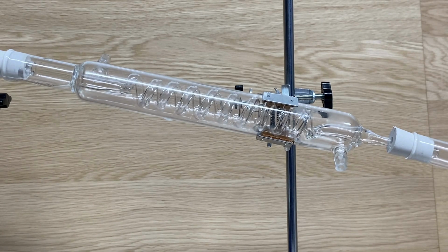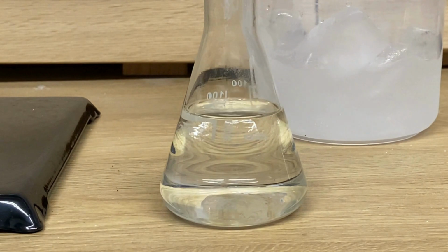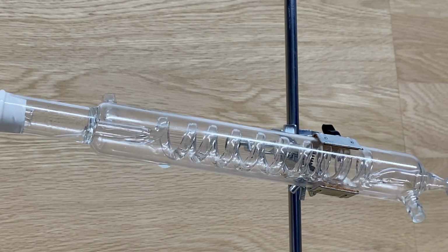After about 2 hours, we managed to get about 100 milliliters of purer alcohol, and I let it cool down for the night. The next morning, I was able to weigh the alcohol, and it turned out to be between 92 and 93% pure alcohol. And this brings us to the question from the beginning. To what percentage can you purify alcohol by distillation this way? And if there is a limit, what is the cause of that limit? Well, the limit will be, under normal circumstances, 95.6%.